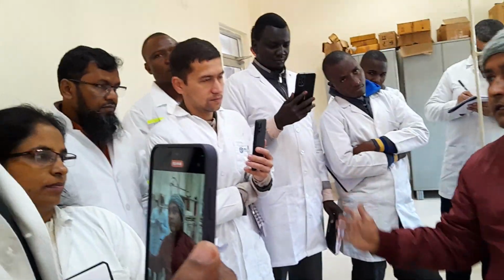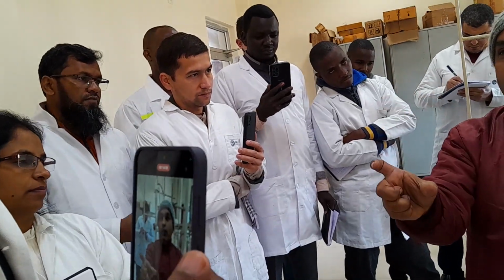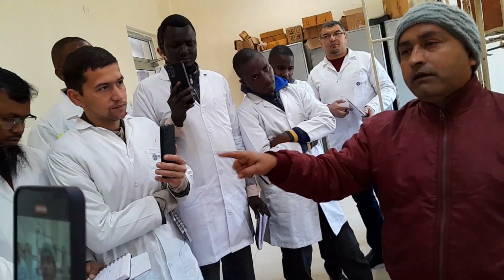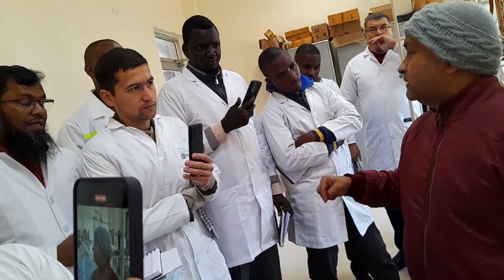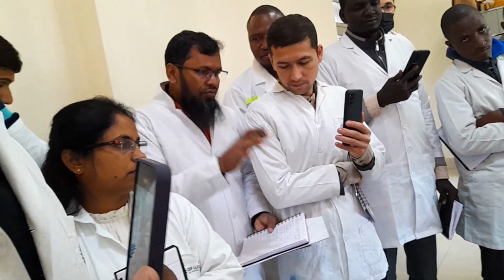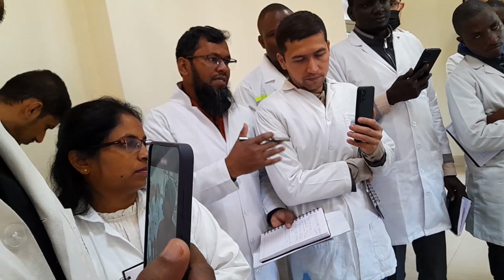But if you distill the crude oil without knowing the Reid vapor pressure and you get a loss more than 1%, then it is your responsibility. If you get a Reid vapor pressure of more than 82.7 kilopascal, say 92, what do you do at that time?